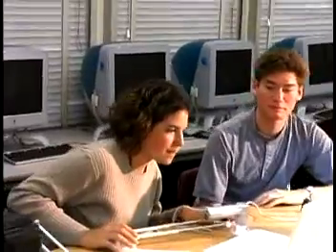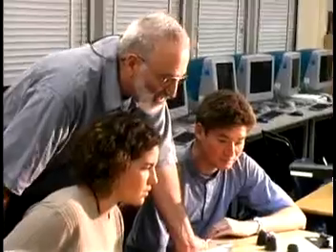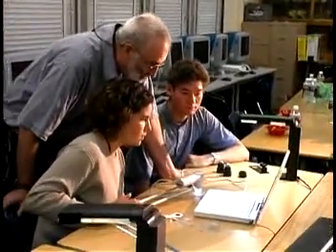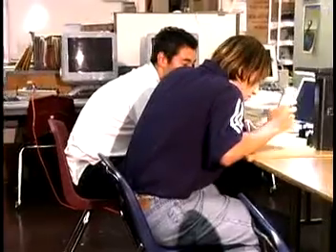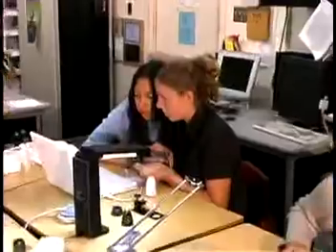Every beach has a fingerprint. Just like each of us are different, and we can identify ourselves by our fingerprints, beaches have fingerprints also. I know when my students get through with this lab and they go down the beach, they look at that beach differently the next time. And they come back and tell me that. And this is where the teacher comes in, giving students opportunities. Opportunities to look, opportunities to learn, opportunities to explore new things they've never looked before.